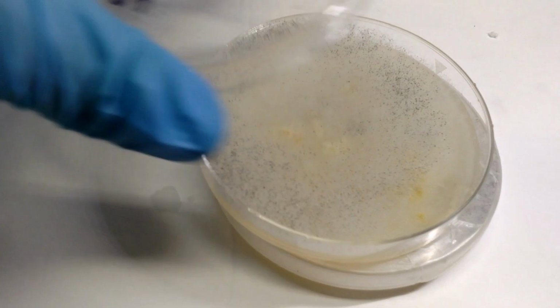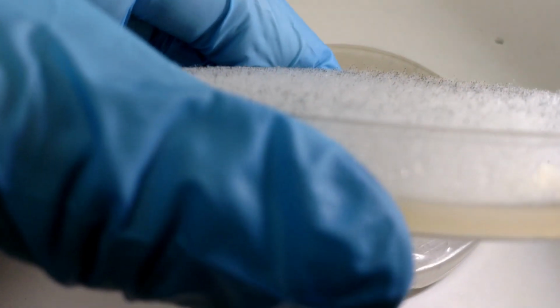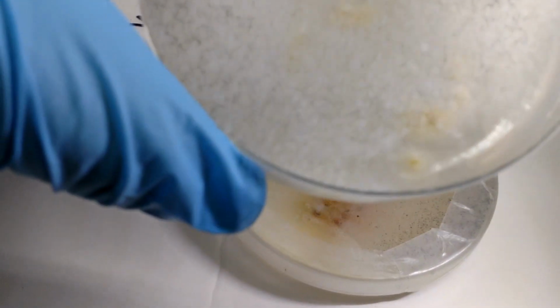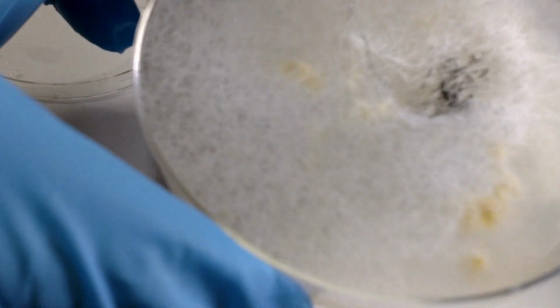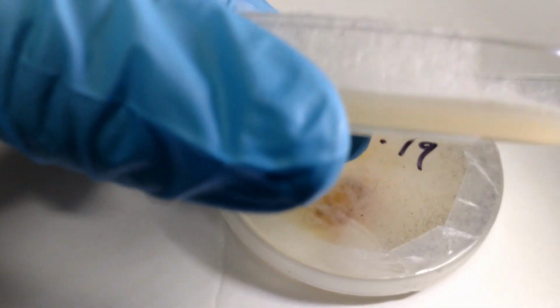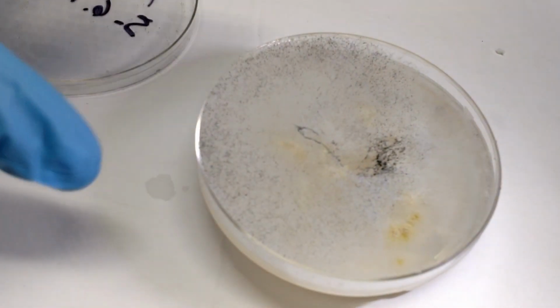Here's the filth. Oh my god. That just breaks my heart to see, but that is three-dimensional. Look at that. Is that not crazy? That is cobweb. Yeah, it's 3D. You can really see that it fills the dish. It's almost like lather or head on a beer. Crazy. I'm all nasty now.